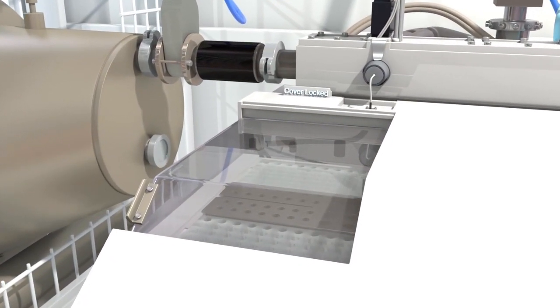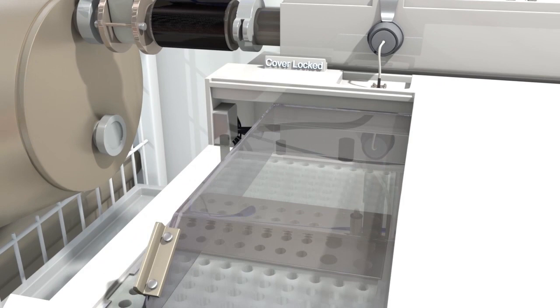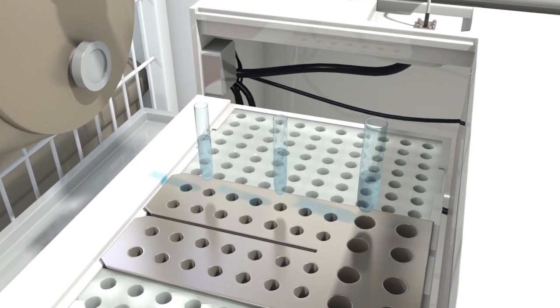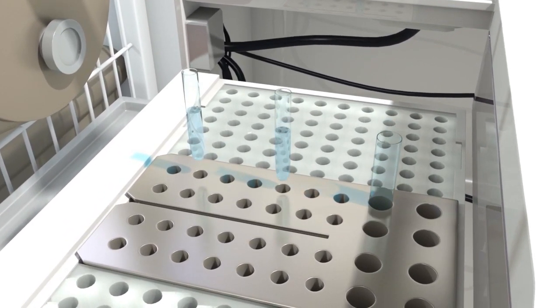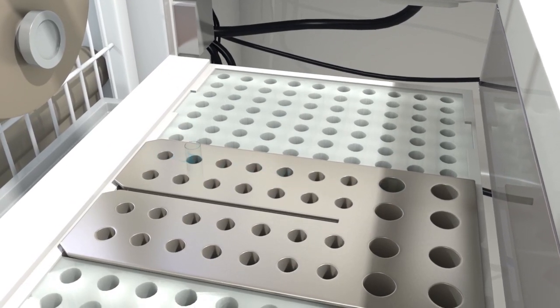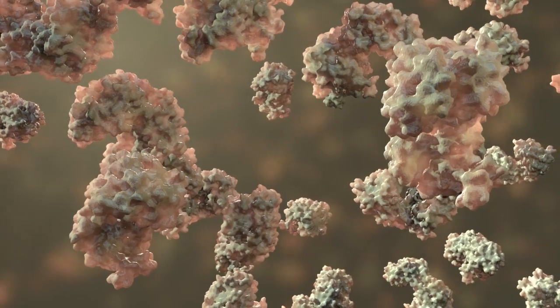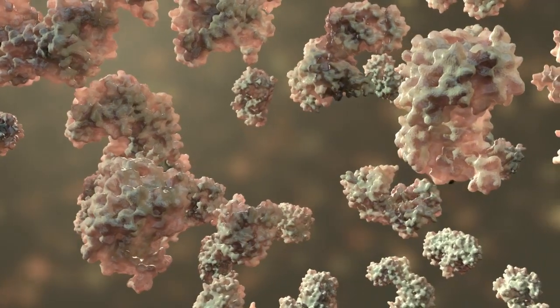A SAXS experiment starts with loading a liquid sample into the sample loader, which may contain any type of macromolecule that we want to study. In this example, the sample contains proteins, whose shapes will be probed by a highly focused beam of X-ray radiation.